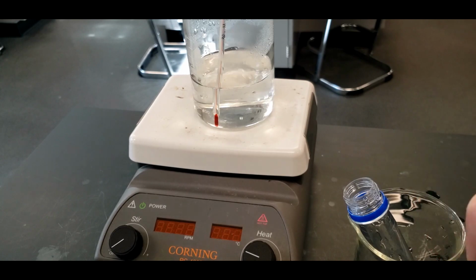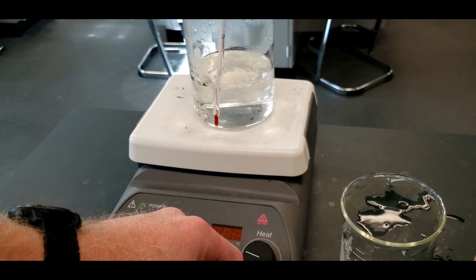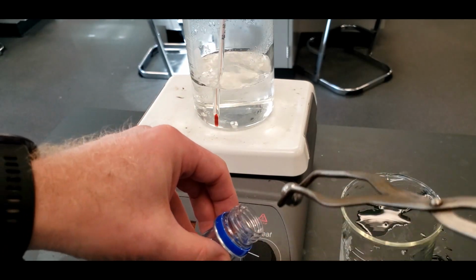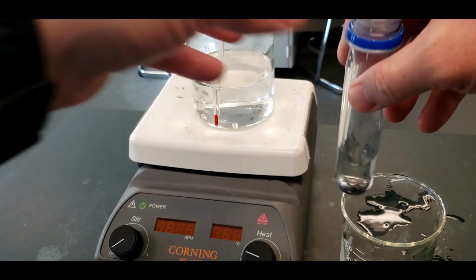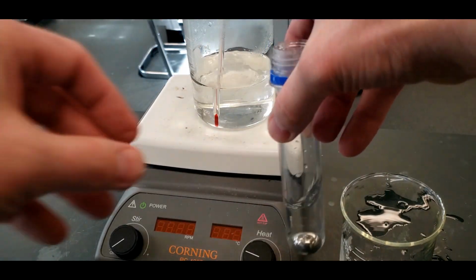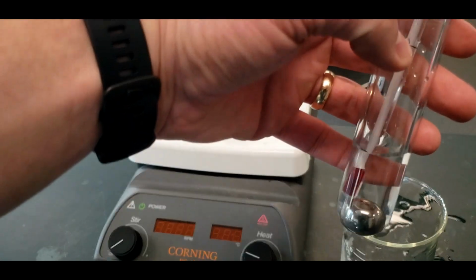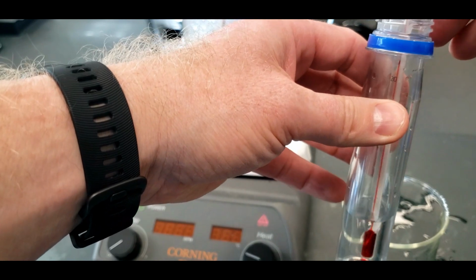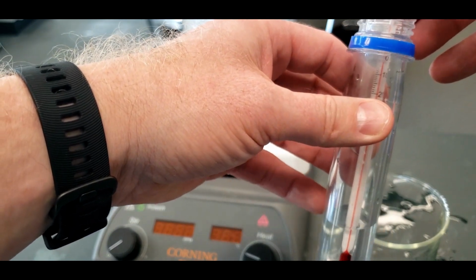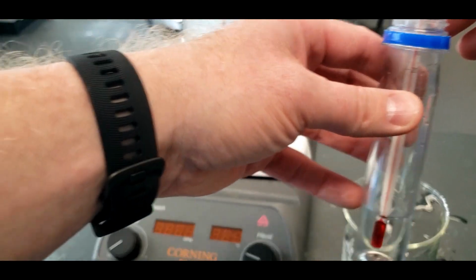And so I'm going to have this, and let me put it up here so you can see it. In you go, slide that down, goes in. Gonna mix it around a little bit, and then put the thermometer in. Be careful, you've got a piece of metal in there and a very thin glass tube, so you want to make sure you don't break anything.